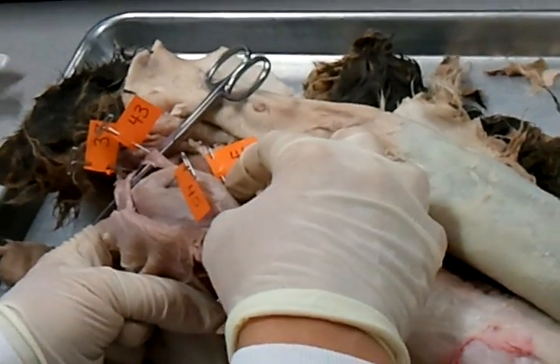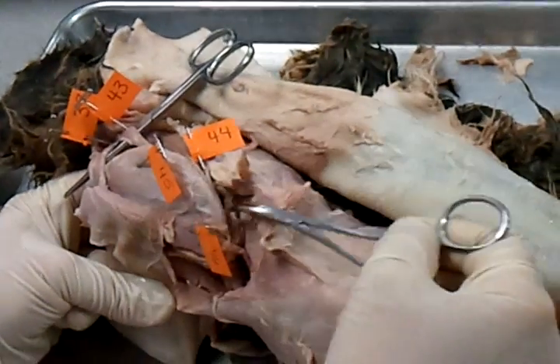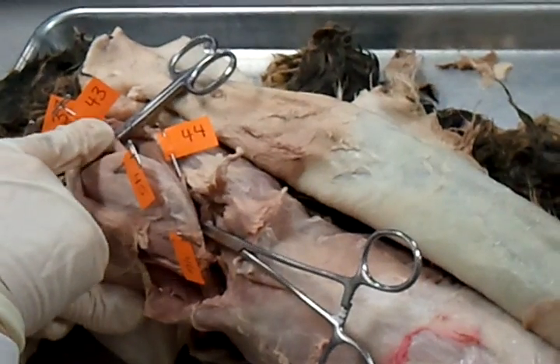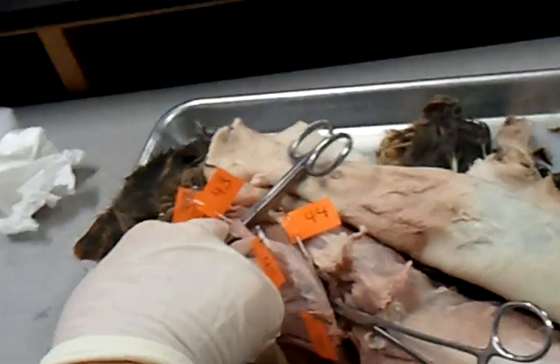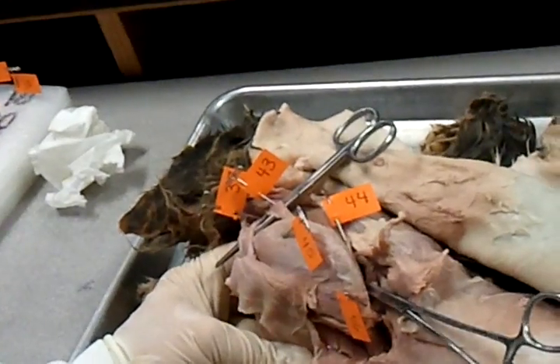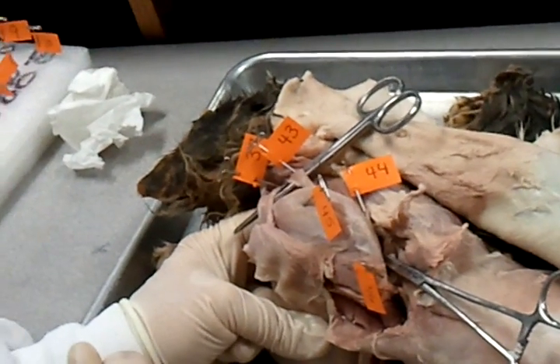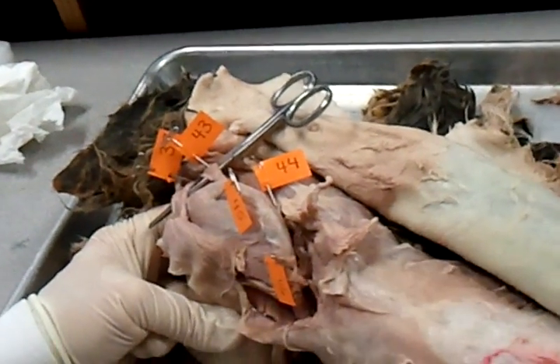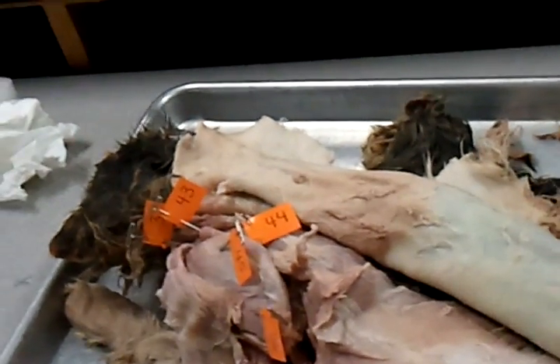The rhomboids will be in a block like this. We'll probably wedge something in the shoulder so you can see where the rhomboids are. This one is going way up into the neck — it's a different muscle. There's one more muscle I have to show you, and that muscle is something called an intercostal muscle.